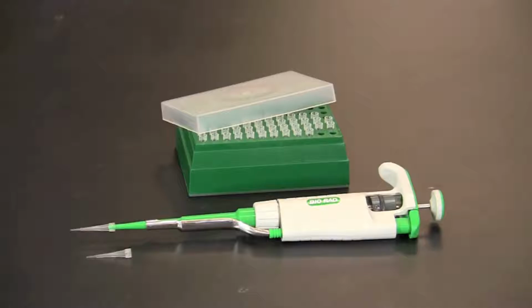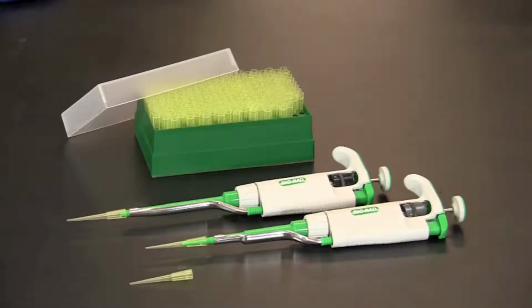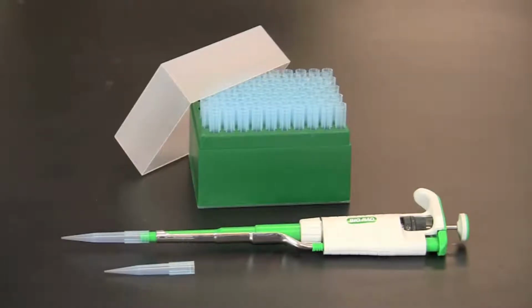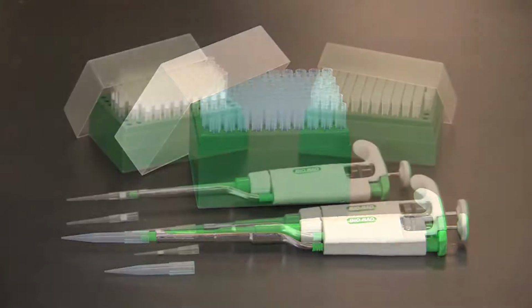The first step in using a micropipette is to make certain you are using the correct size and type of tip for the samples you will be transferring. Tips for general pipetting come in three standard sizes. The 0.5 to 10 microliter shown here. The tips shown here fit either a 2 to 20 microliter or a 20 to 200 microliter pipette. Tips that fit 100 to 1000 microliter pipettes.